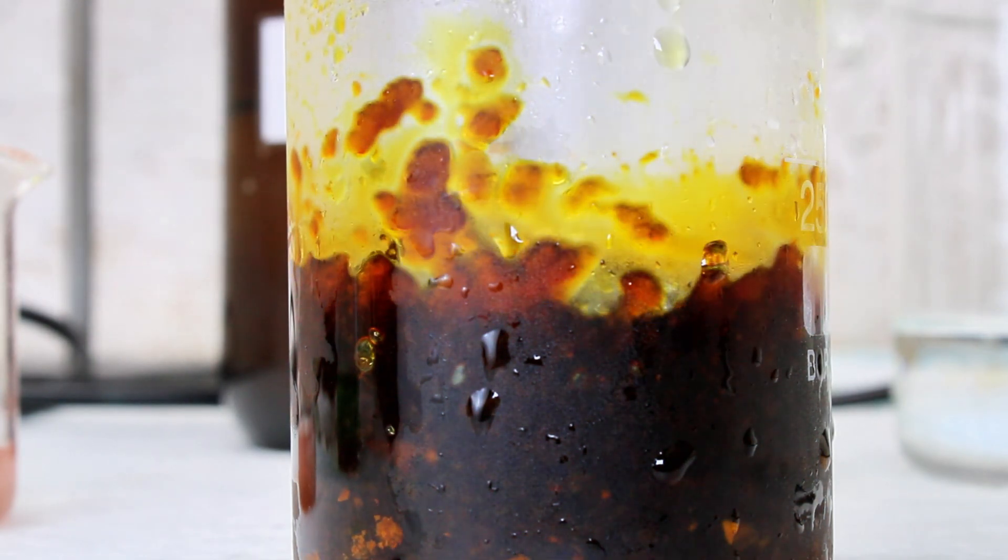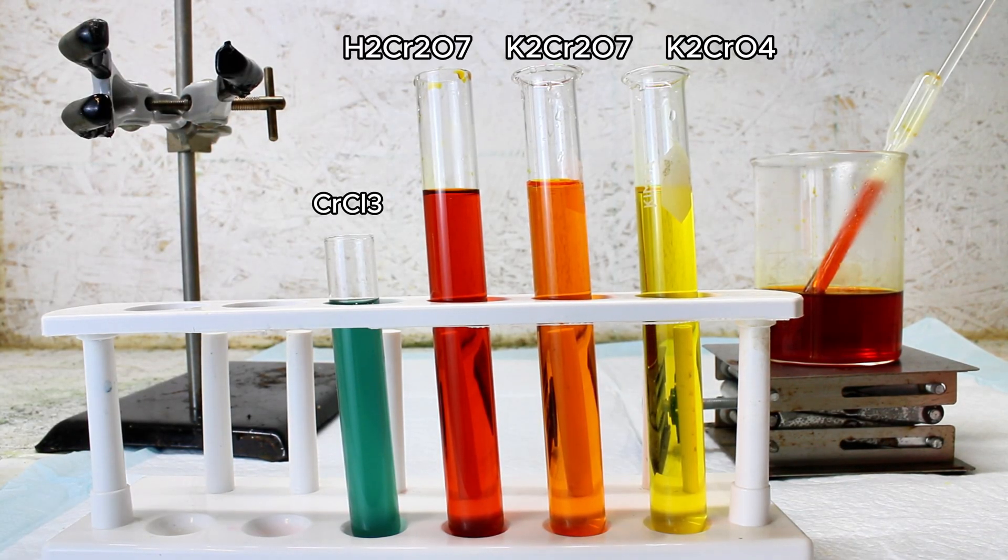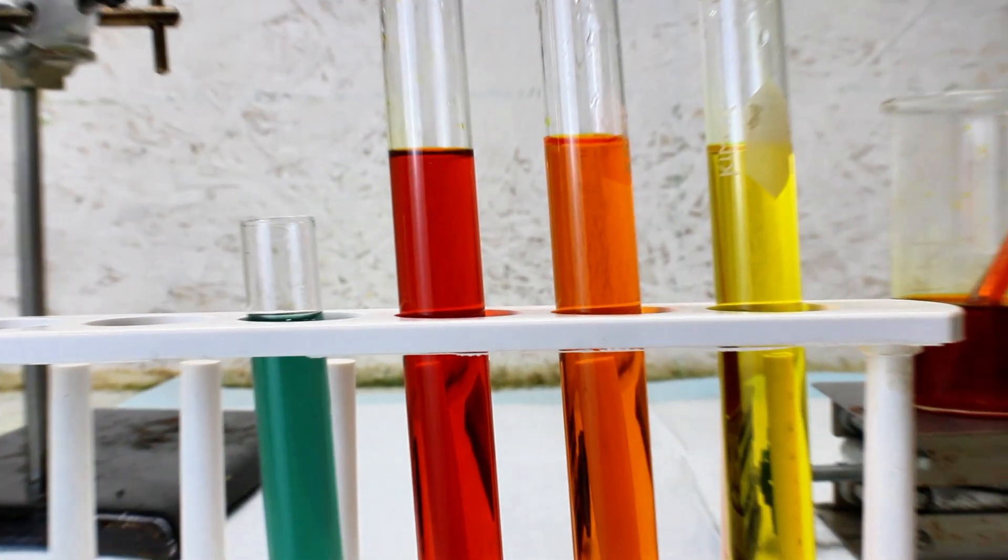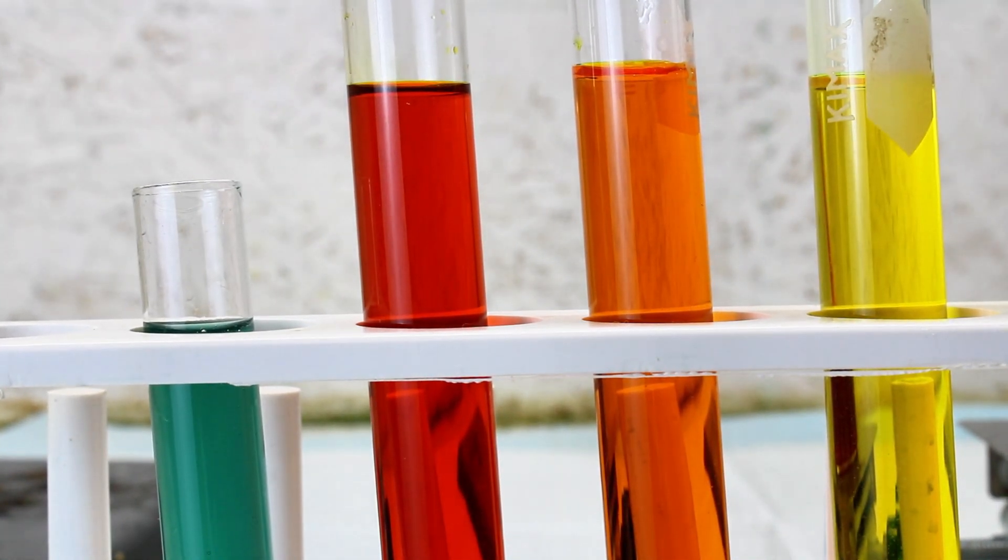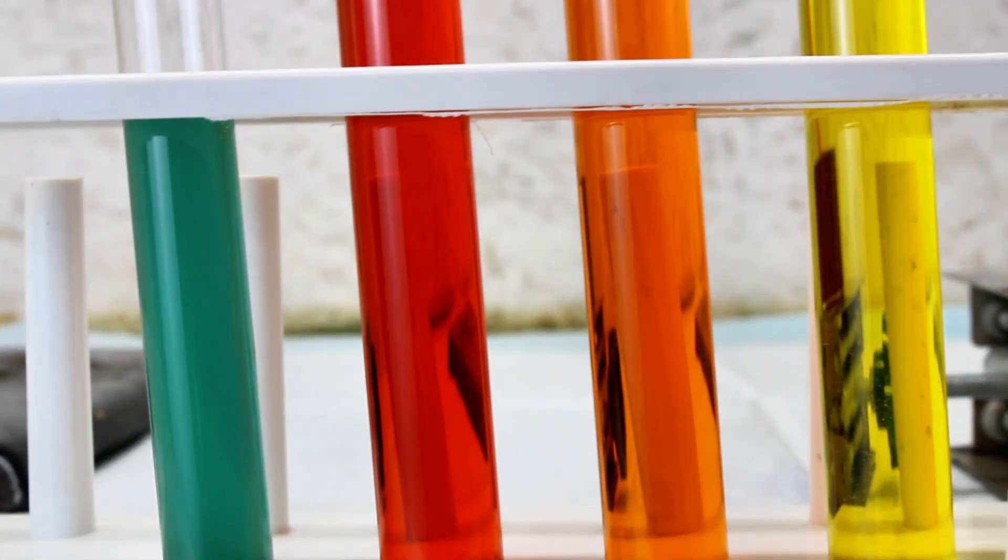Anyway, that's about all I've got on chromium for today. Here are a couple of the colors that I got out of the chromium during this project. And as a side note, chromium is actually named after the Greek word for color, due to how extremely vivid chromium compounds like these are.